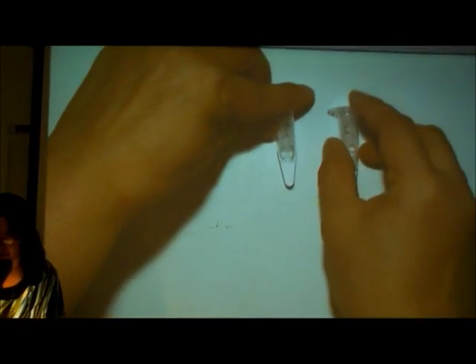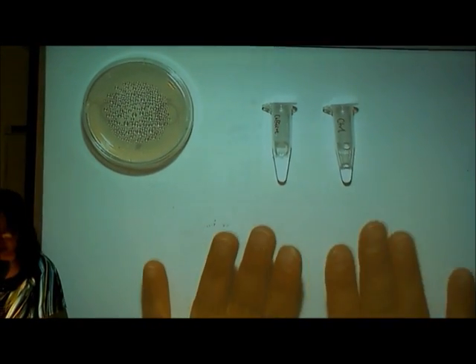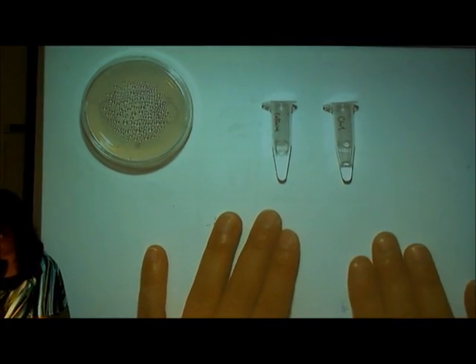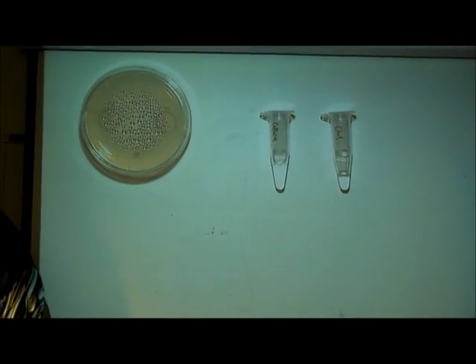So this is caffeine, and your control is water with sodium azide. Make sure that you mix your chemical with sodium azide to immobilize your animals once they approach them.